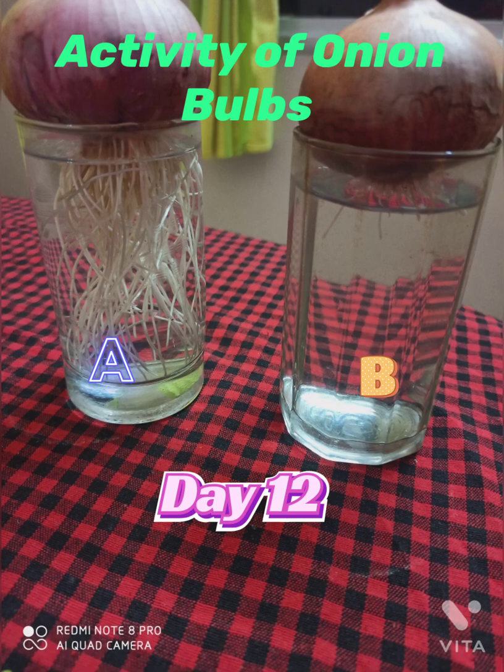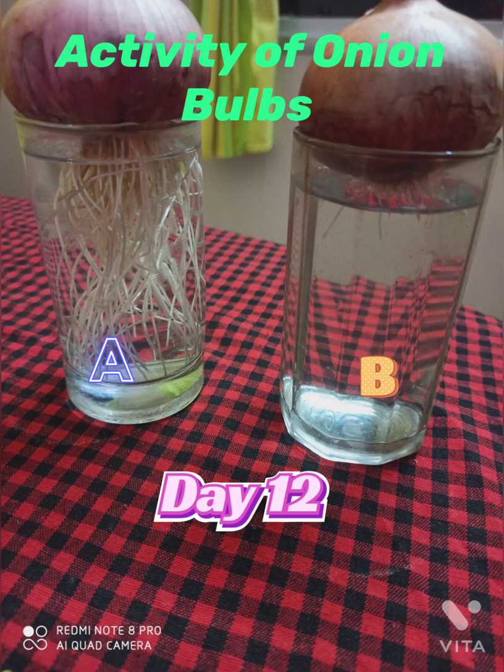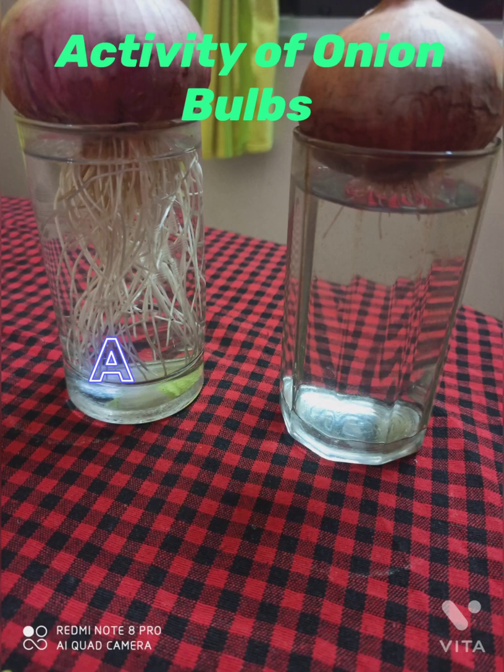This is the observation on day 12. In beaker A the roots have almost reached the bottom of the glass tumbler and are growing enormously, whereas in beaker B they are not growing at all as the root tips were cut.